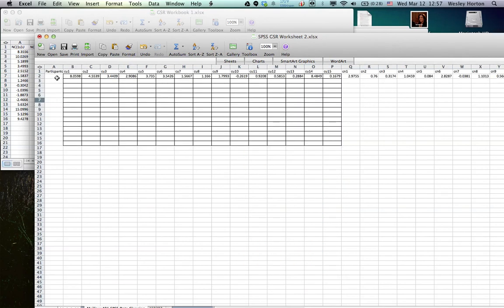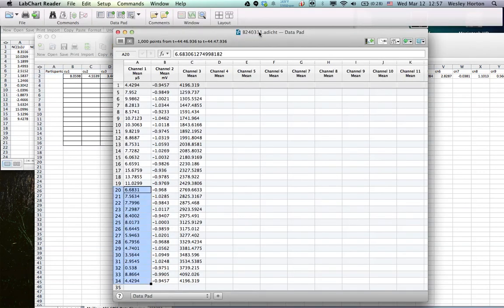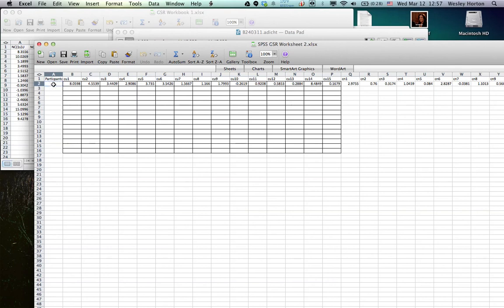Also, at the beginning of everything, you're going to want to make sure you put the participant number in, which is, for this one, B240311. So put that in there as well. There we go. So that's a tutorial for how to get the data analyzable, cleaning it up. Everything's together now. This GSR worksheet will be the input into the SPSS, and then we'll analyze it from there. All right, thanks.